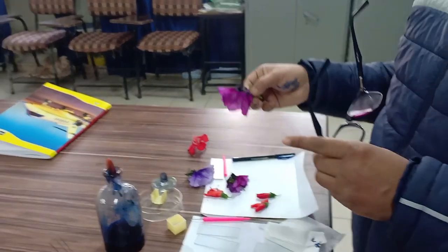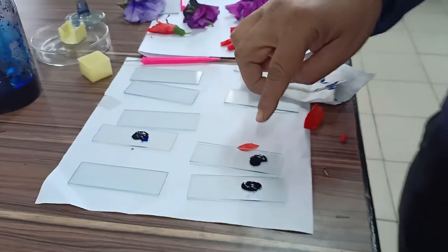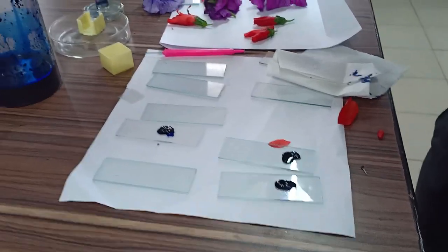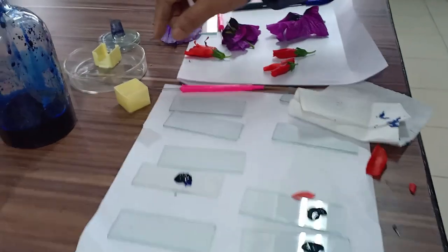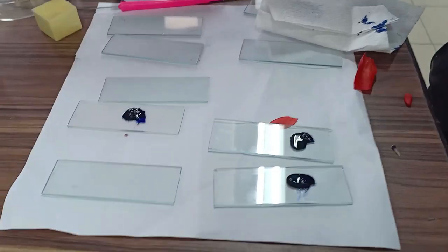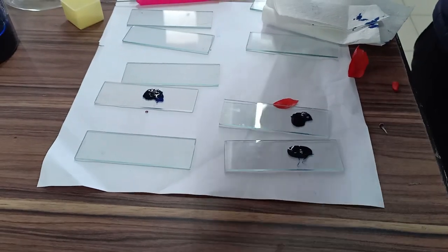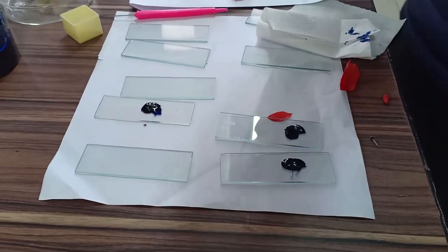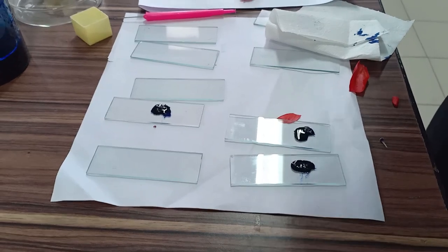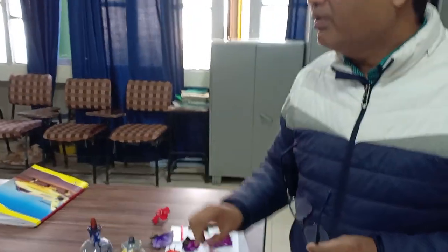Collect the flower from your garden, put the pollen grains on a glass slide, and add one drop of Evans blue solution. Leave it for 15 to 20 minutes, then place a cover slip in a tilted position and remove the extra dye. Observe under a 15x or 100x compound microscope. The cells which are living will not take the stain, but non-living cells will take the Evans blue stain.